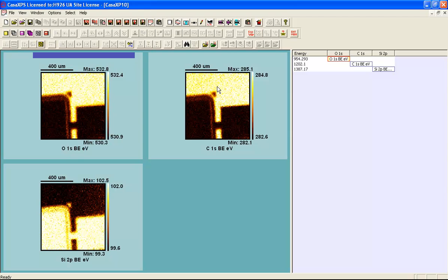And the fact that the carbon and the oxygen have structure is more concerning in terms of charge compensation, because we can see, especially from the carbon, that there is a significant shift in the apparent binding energy as we go from the elemental silicon-rich part to the oxide-rich part of this sample. Given this carbon image, we can make use of this to partition the intensities into a set of zones which we can use to construct spectra. So we can add spectra pixels and produce spectra that correspond to different zones in this image.